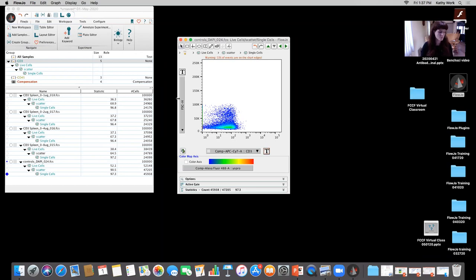Yeah, exactly, that's very true. And it's important to understand that the scatter plot is probably one of the most difficult plots to interpret, especially if you're a novice in flow cytometry. It just seems like a huge cloud, and it's hard to distinguish between debris, live and dead cells, cells that are activated, etc. Right. So like Kathy was saying, that's why we use fluorescence to distinguish between these cells.